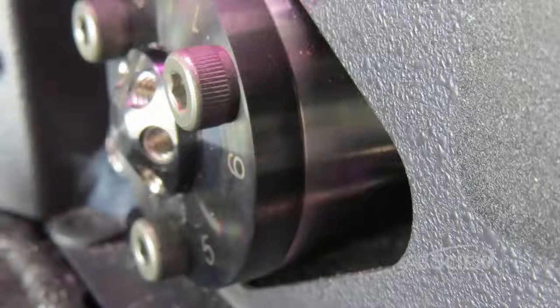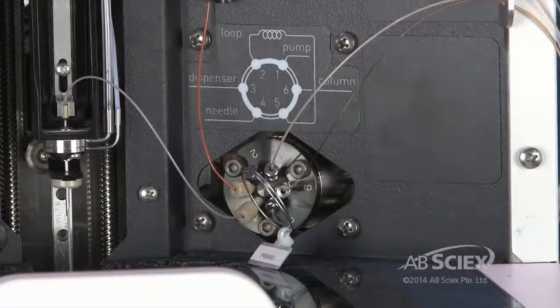Inspect the gap between the valve body and the stator. There should not be a gap. Replace the fittings on the valve.